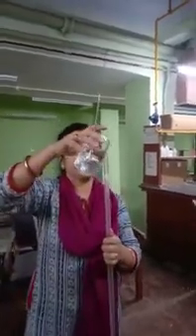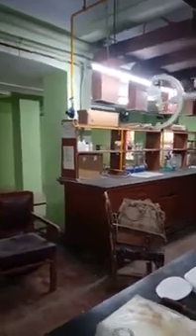This neutral formalin solution will now be added to the glycine solution. Before you start estimating glycine, you need to free glycine of the zwitterion. So to 25 ml of glycine, you add 2 drops of phenolphthalein as an indicator and add sodium hydroxide. Automatically, if any NH3 plus is formed, it will be neutralized. So you will have the free glycine now. The amine group and the carboxylic acid group, both will be free.